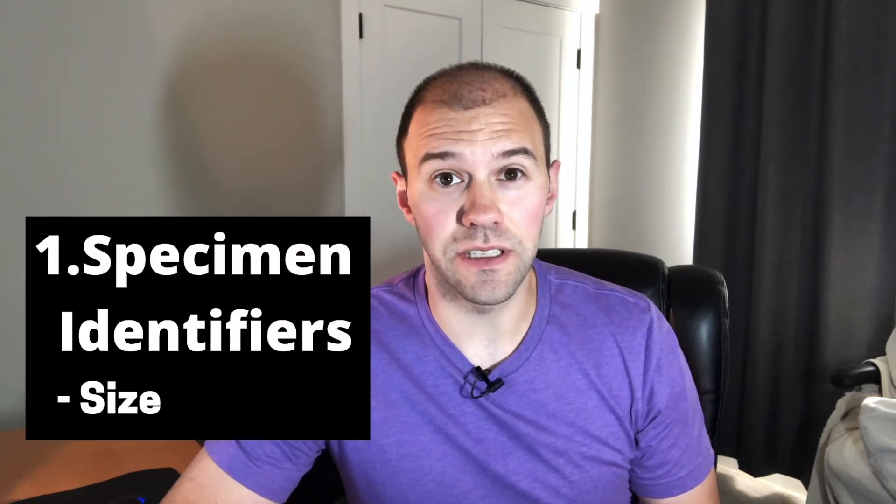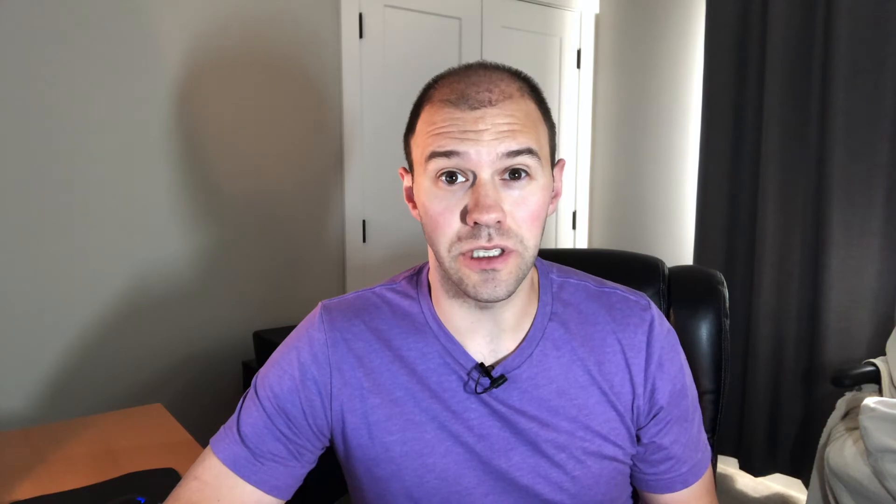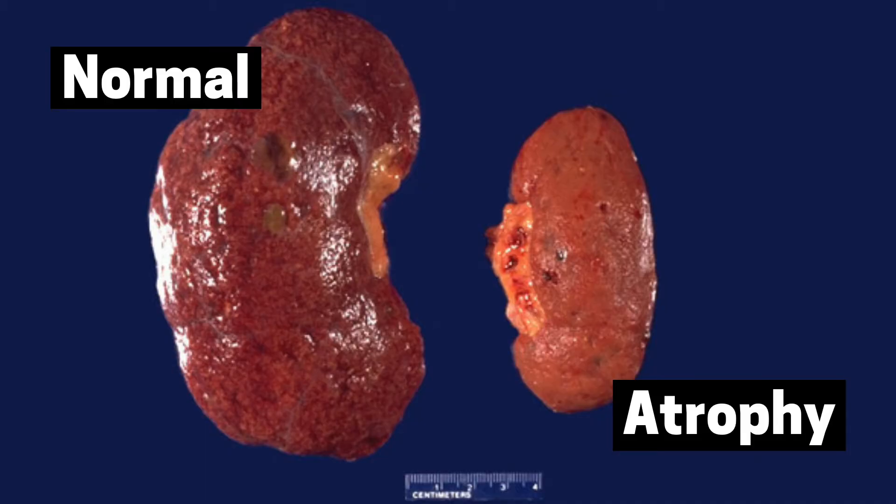The next thing to describe is the size of the tissue. Generally you can include both qualitative and quantitative measures. Quantitative would be the actual measurements — so if it's 10 centimeters by 8 centimeters by 8 centimeters, include that as well as the weight. If the tissue appears enlarged or shrunken, those are good things to mention too, because sometimes there are hypertrophic or atrophic processes that may affect the visual appearance.